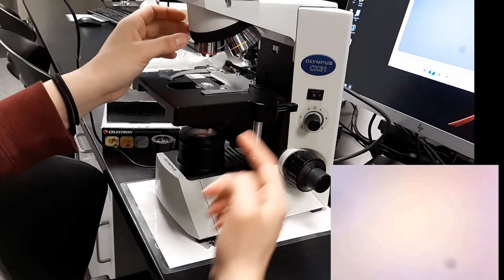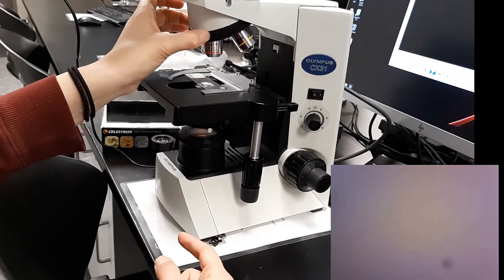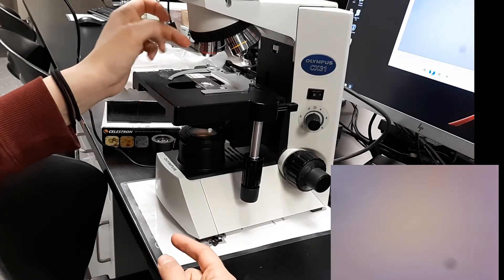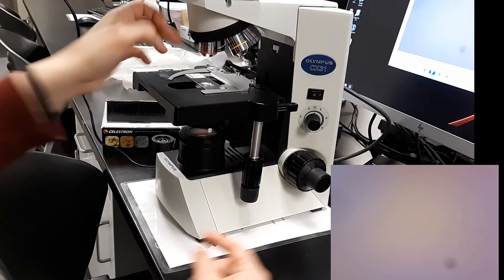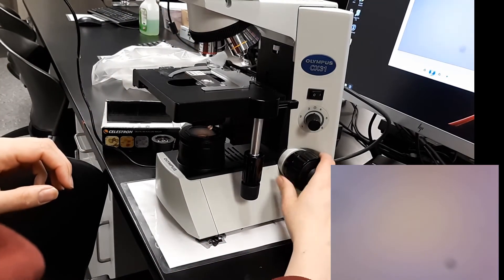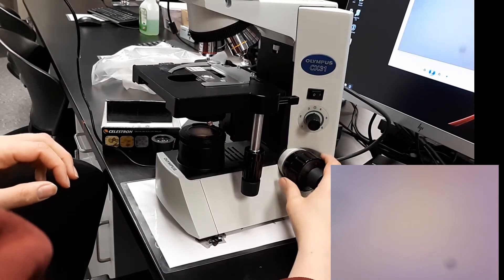And by the way, if you notice, I need to make sure I use this nose piece to rotate this objective, this four times red objective into place. Rotating up.